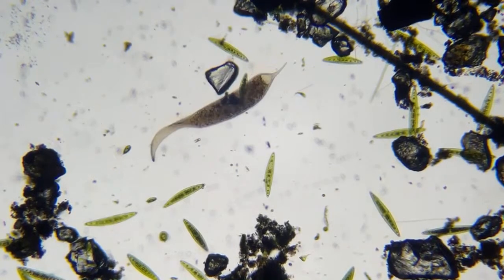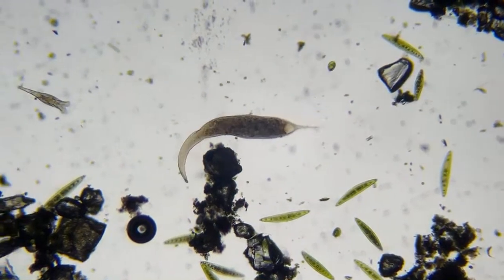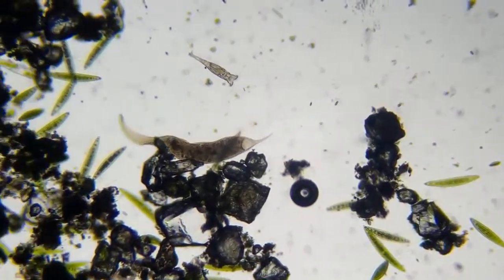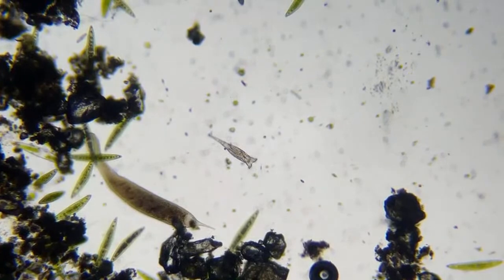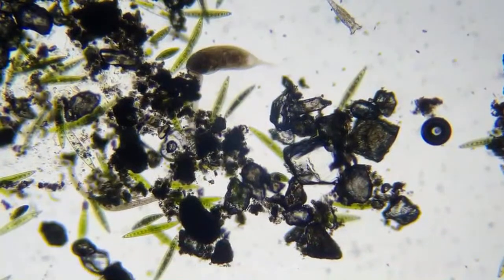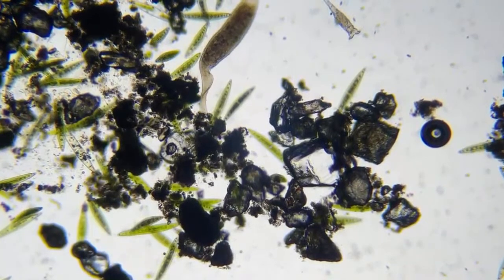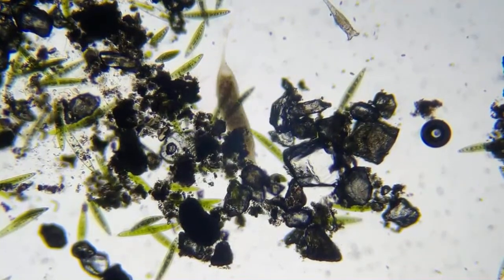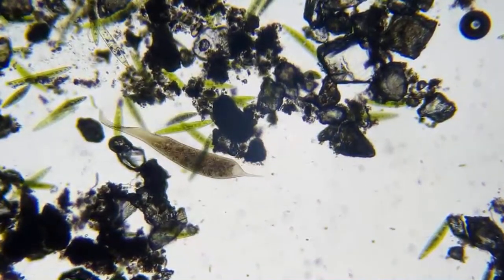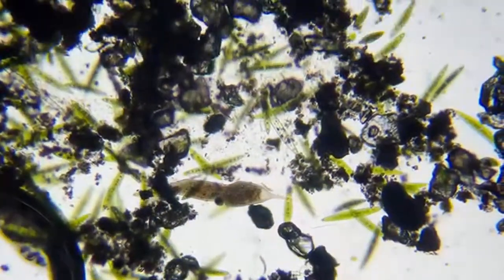And he won't eat those Closterium. He usually likes live stuff like this rotifer right there. And that other thing that just passed by was a Spirostomum. Yeah, those green things are alive. That's algae. Closterium, I believe you pronounce them.